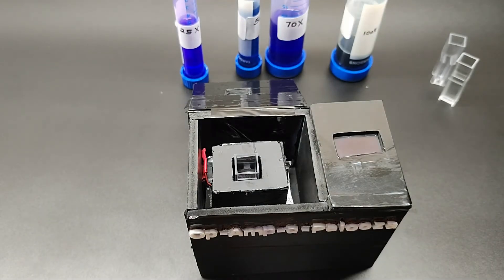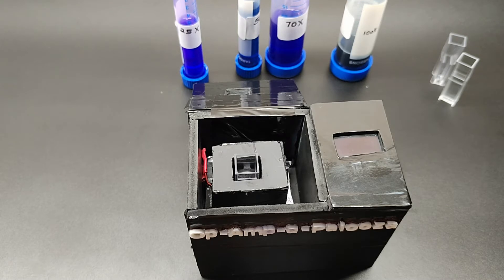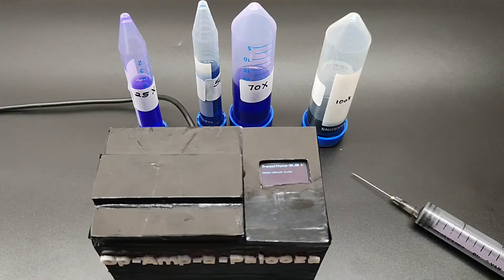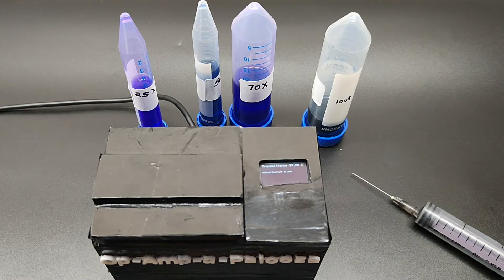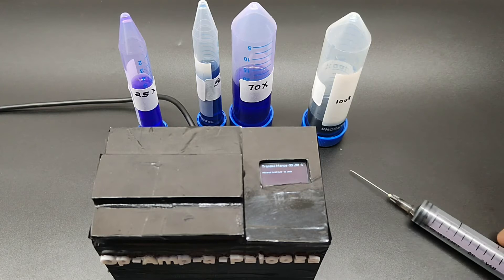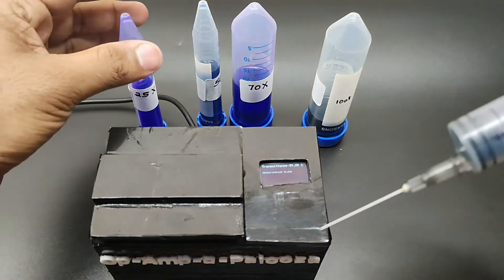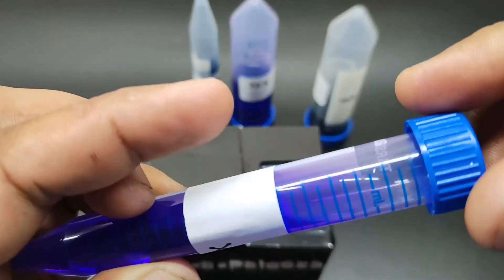Let us start the experiment and see the results on the OLED display. I am using a syringe to draw the liquid from the stock. I will test the 25x liquid first — now I am going to take the liquid from the stock.